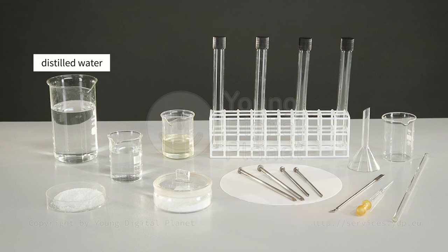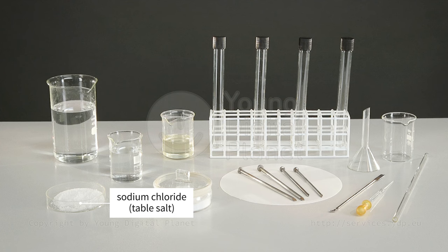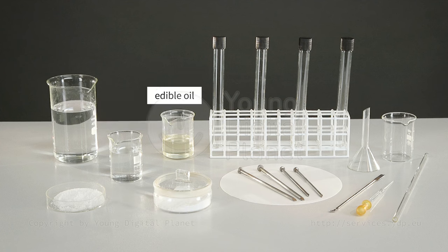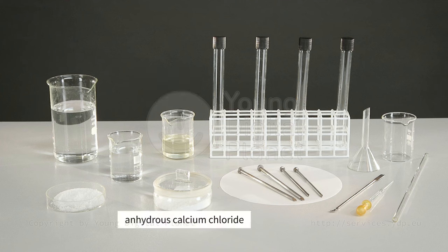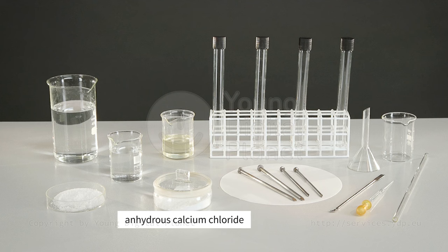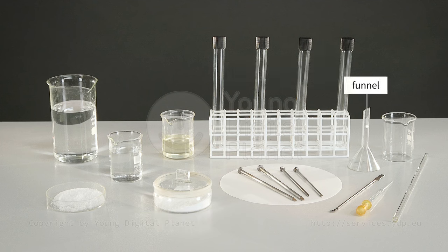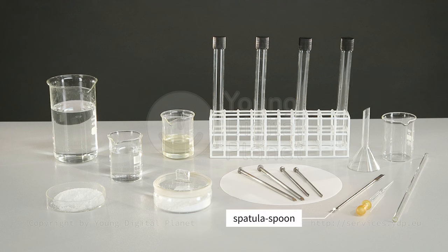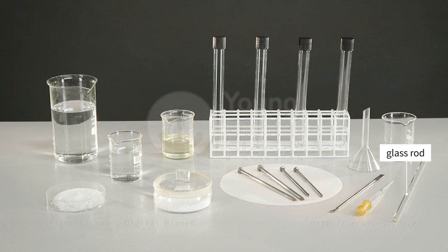Distilled water, sodium chloride, freshly boiled distilled water, edible oil, anhydrous calcium chloride, and test tubes with stoppers. A beaker, a funnel, a pipette, a spatula spoon, and a glass rod.